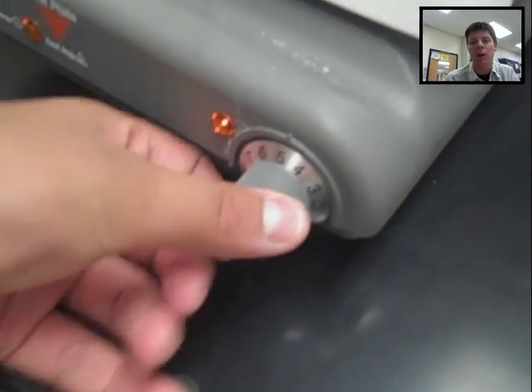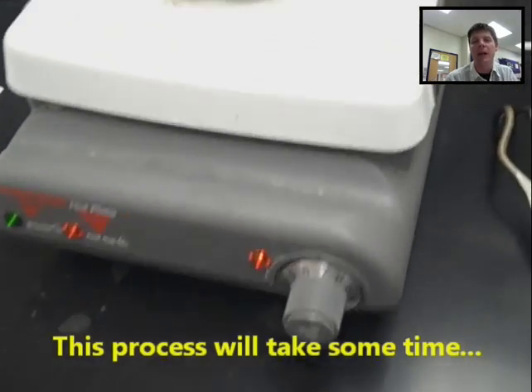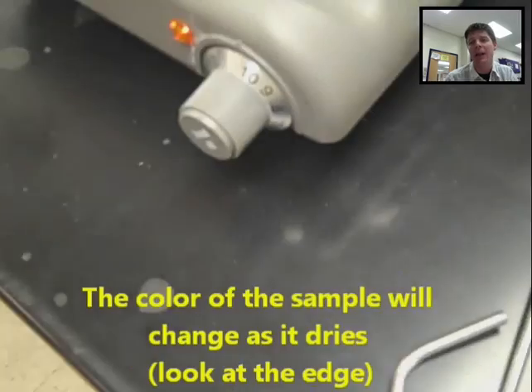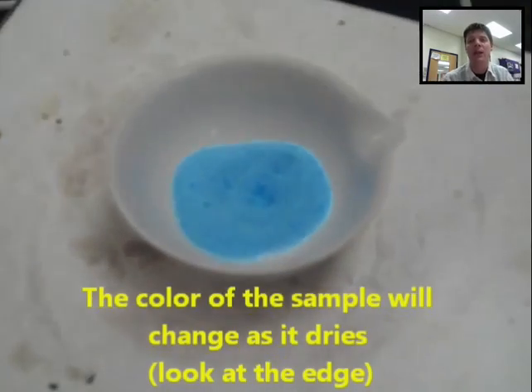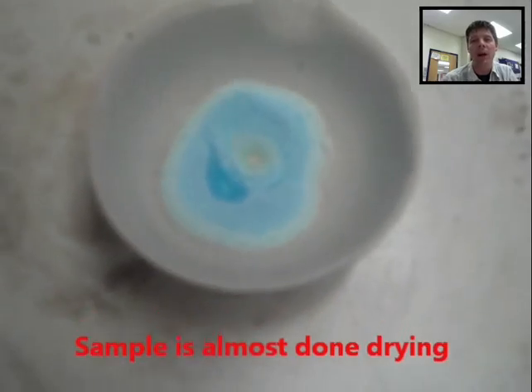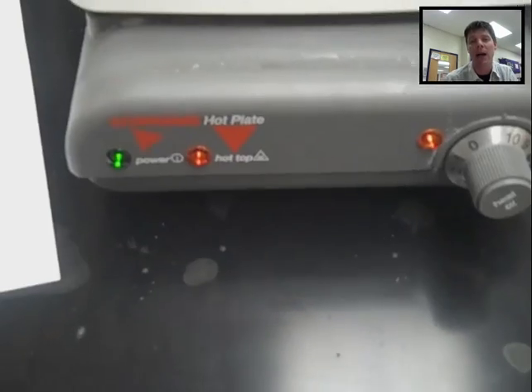Now what the students are doing here is they're going to heat the sample of copper sulfate. Copper sulfate is a chemical compound that belongs in a category that we call hydrates, meaning they're hydrated — there's actually water incorporated within the crystal lattice of the compound. What is true of hydrates is that there's always going to be a specific ratio of the compound to water. For copper sulfate it happens to be a 1 to 5 ratio, so we call it copper sulfate pentahydrate.